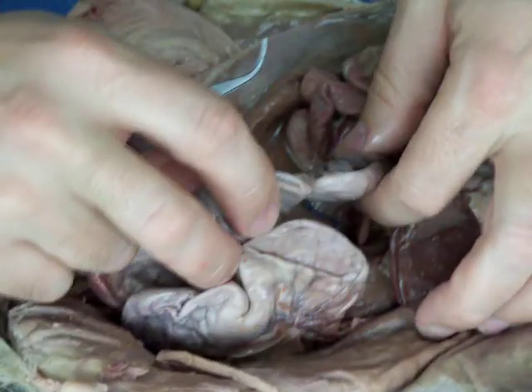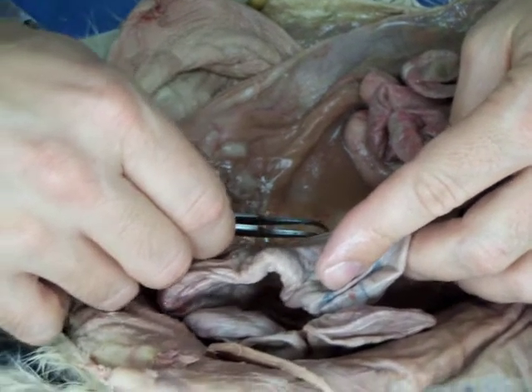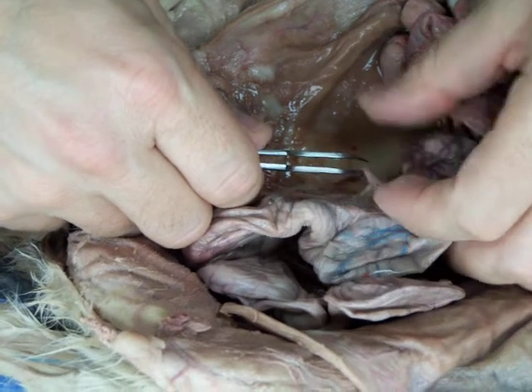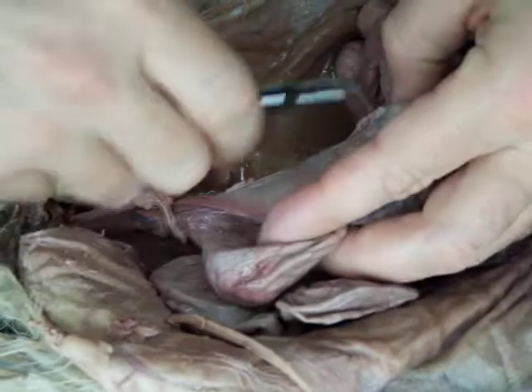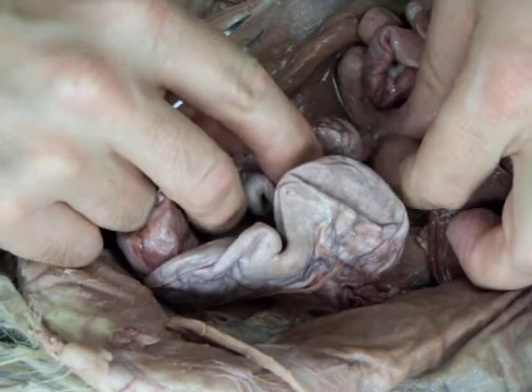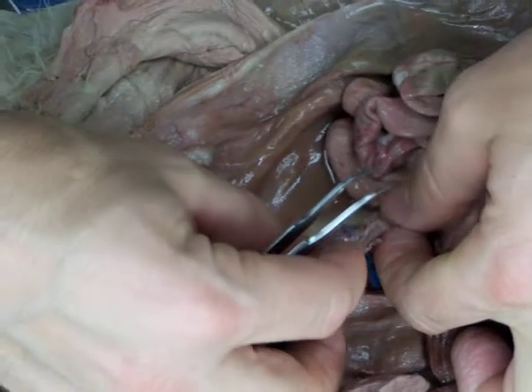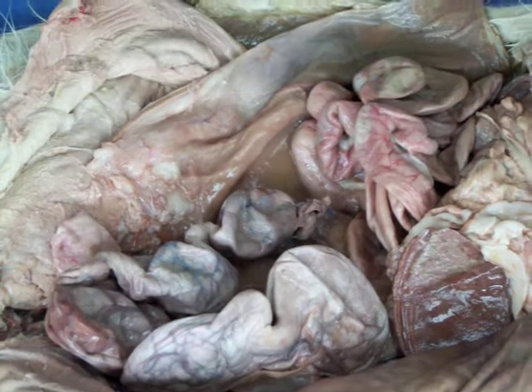Around the ovary and attaching to the uterus, it's been kind of cut here, torn here, but this is the mesovarium, and with the uterus, what do they call it in here? Mesometrium. Mesometrium. It's a continuous ligament, and the mesometrium is this large portion that attaches to the uterus, and this is part of the dorsal mesenteries I was talking about today. And then at the ovary, it's the mesovarium. And then the end of that is the suspensory ligament, and you can see that suspensory ligament right where my finger is here. See it attached to the ovary? And if you think about it, in the humans, the ovaries would be suspended from that end of the connective tissue.